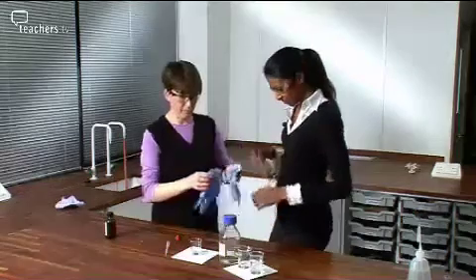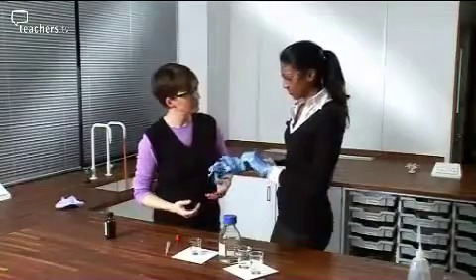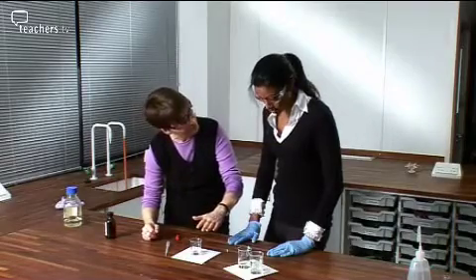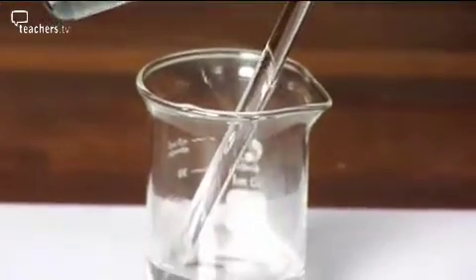I'm going to get you to put a pair of gloves on. And these are nitrile gloves, so they'll protect you from splash. What we need to do now is pour solution B so that it forms a layer on top of solution A. And the reason why you do that is that when the two layers come together, because the organic layer is over the aqueous layer, it traps it, and the hydrogen chloride dissolves in the water underneath. Try with the glass rod, and you need about the same depth again.